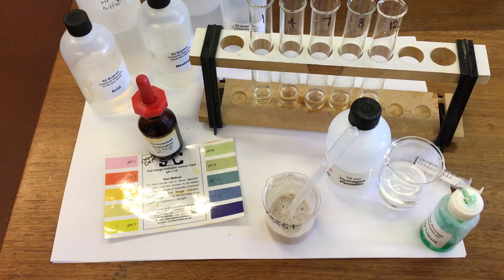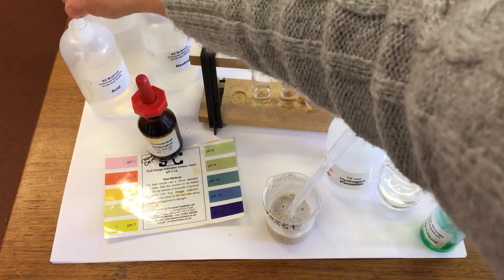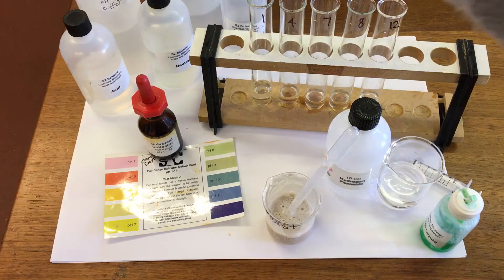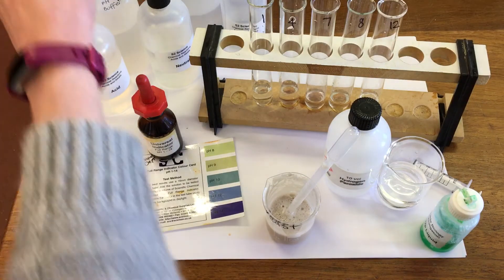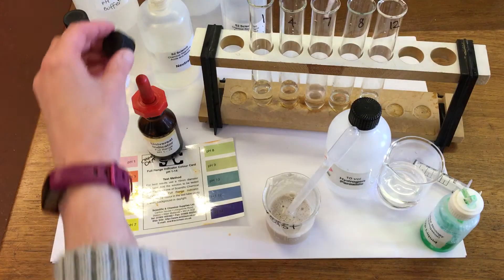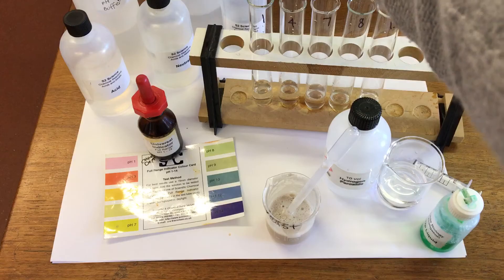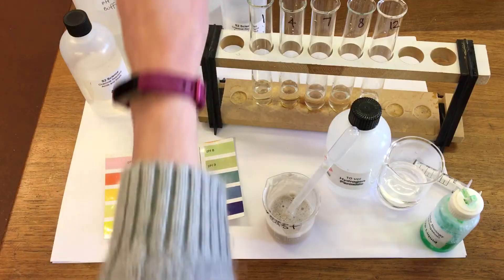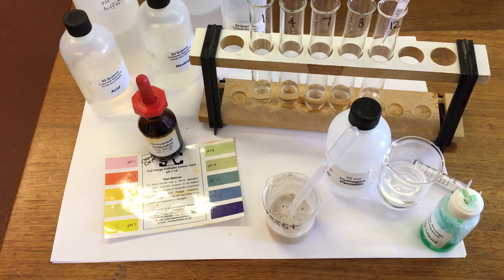And then we're going to change the pH by adding different acids and alkalis. So first of all, we're going to add some strong acid, and then a slightly weaker one, a neutral solution, some alkaline, and a stronger alkaline.